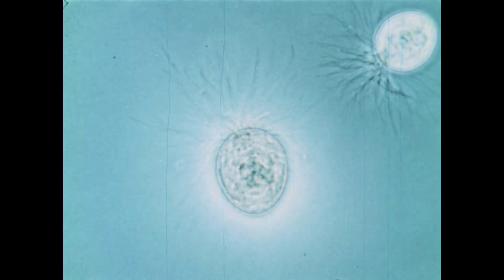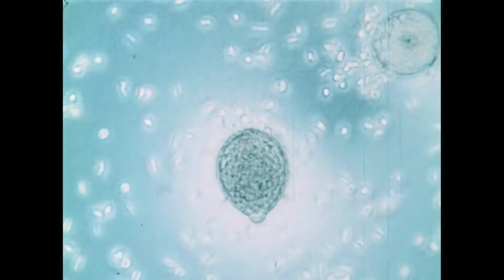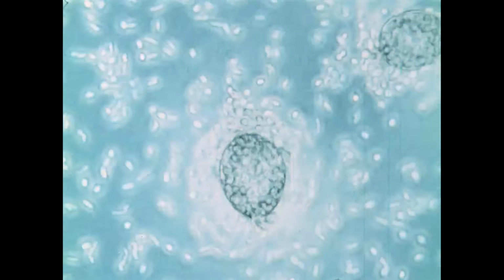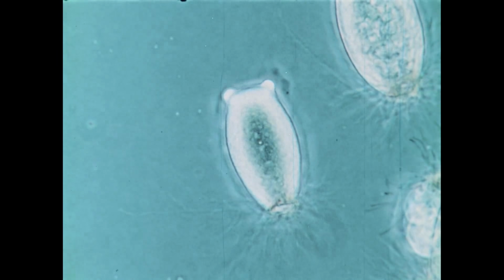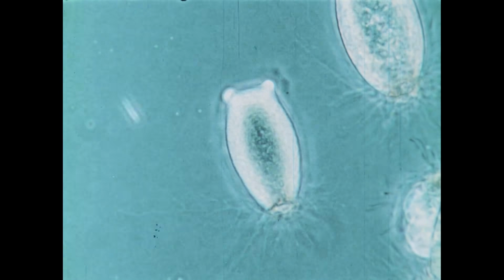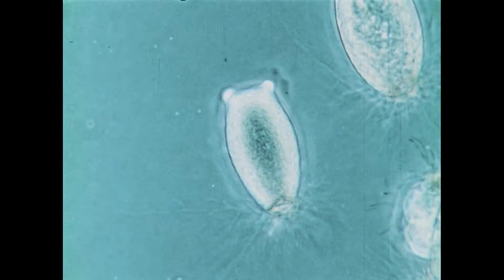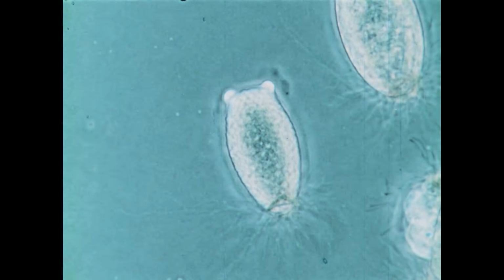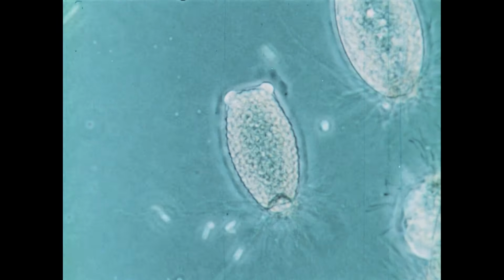One or more discharge papillae will be produced. Their tips dissolve, forming exit pores through which the zoospores escape. Let us look once more at the production and discharge of spores, starting with a full-grown plant. There is a sharp change in texture of the protoplasm as it is partitioned into zoospores. Zoospore formation takes about 10 minutes.